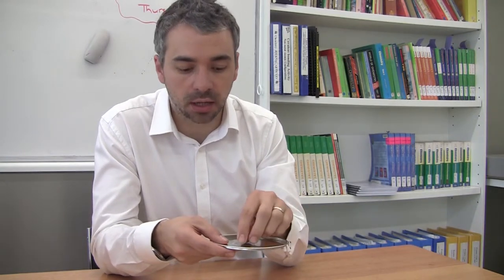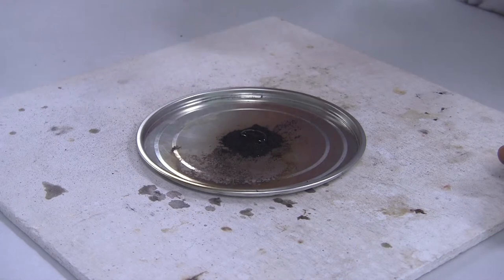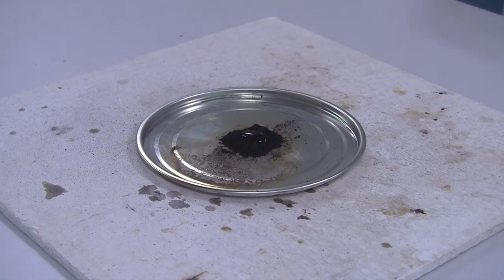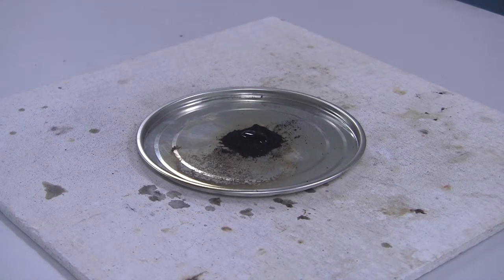If you've ground it up sufficiently, in a good five seconds or so, you'll start to see the glycerol start to spread throughout the well and then hopefully you get a nice big purple flame.